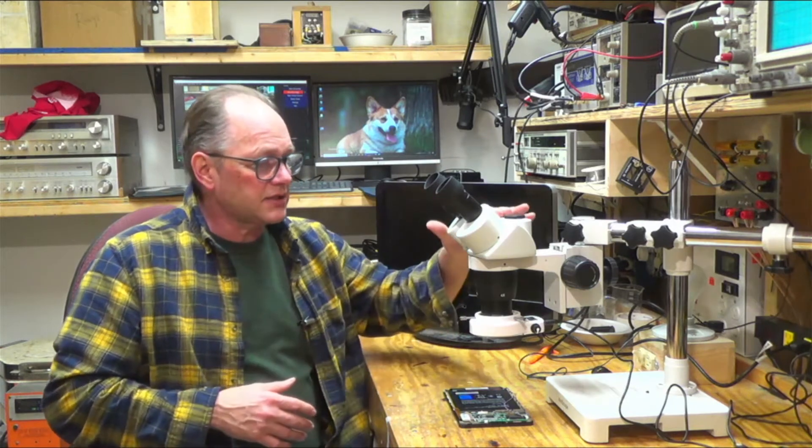And I wanted to be able to bring that directly in or watch it on a TV just using HDMI instead of having to have special software. So a lot of the cameras had special software associated with them, even though they'd be able to just plug in. So I tried to figure out a way that I could buy a decent camera and attach it to this guy.